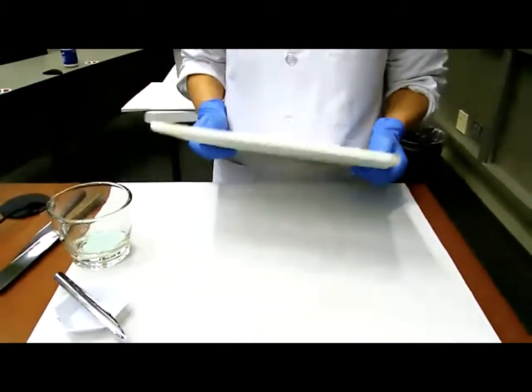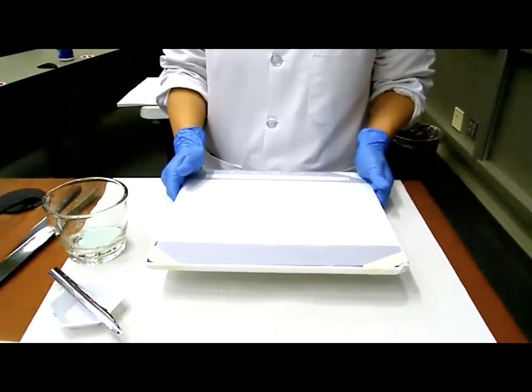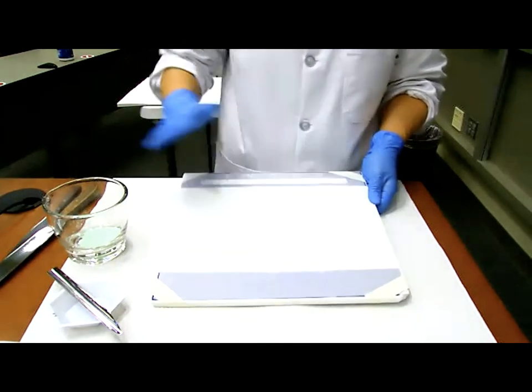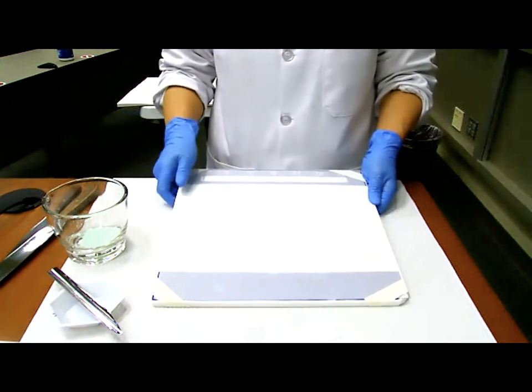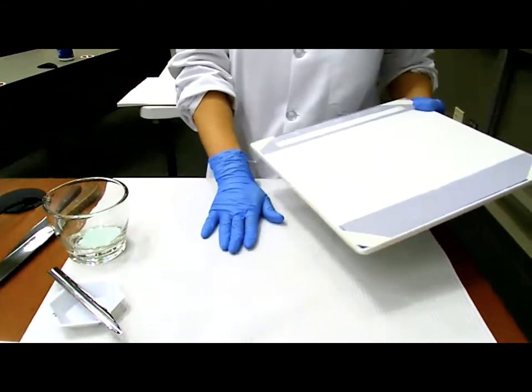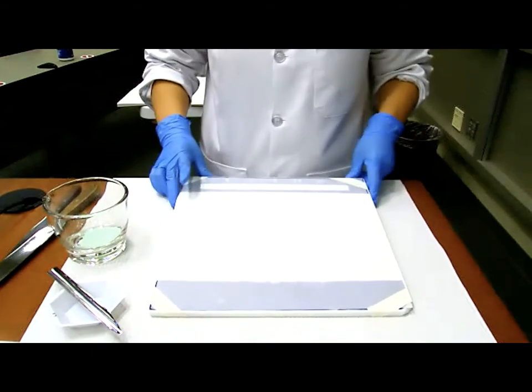Even though you have an ointment slab in your drawer as well, you do not have to use the ointment slab. What you need to do is use one piece of ointment paper, and tape down on your bench directly. The reason that I have to use a slab is because we have a soft paper underneath it, where I cannot perform my procedure directly. So for me, I have to use a slab. You do not have to.